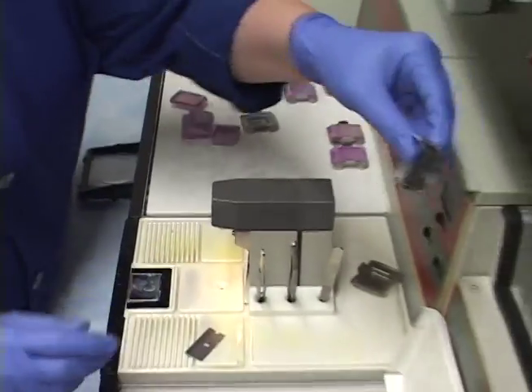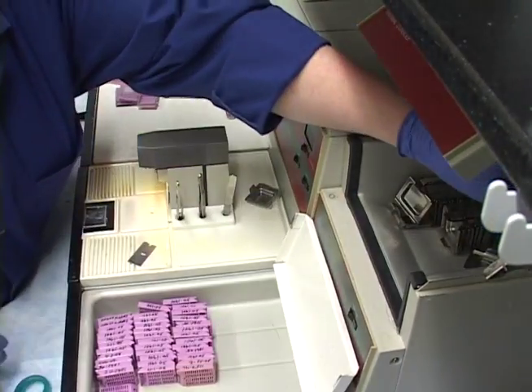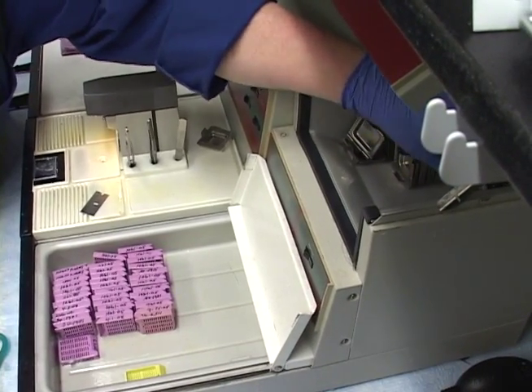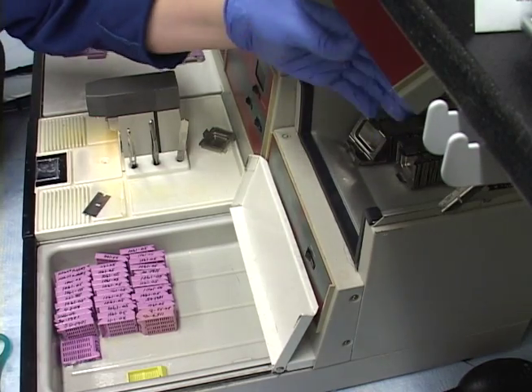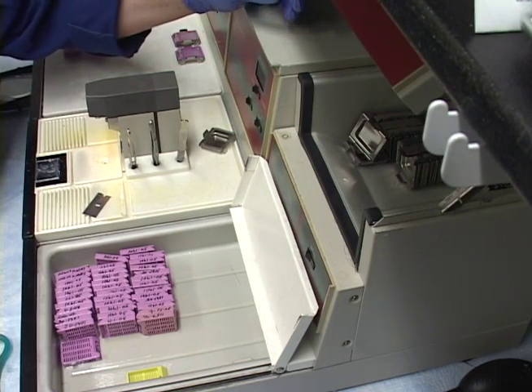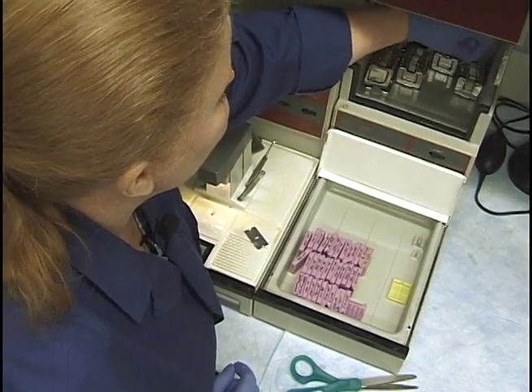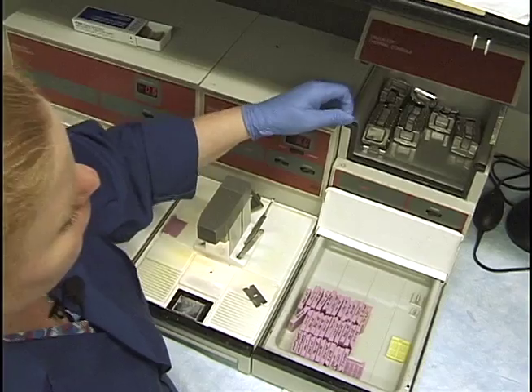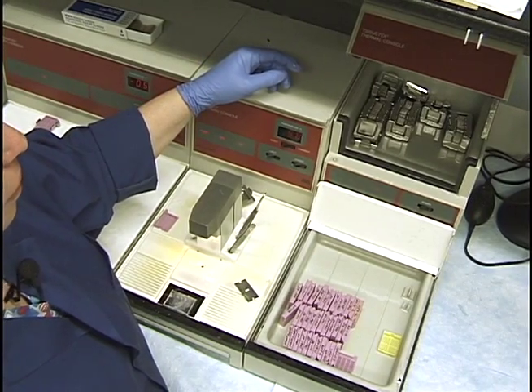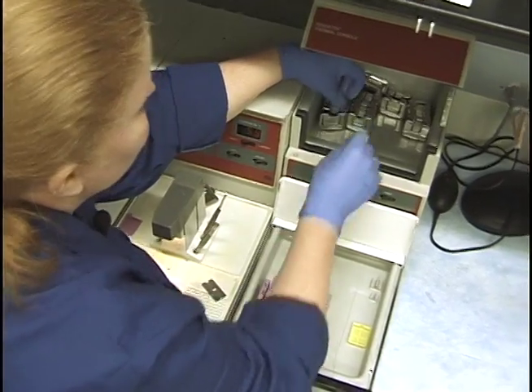The molds are fine — they go right back in. I put them towards the back so they get melted and I can still use the warm ones in front. I try to keep all the molds nice and organized: small ones together, others separate. If you do things consistently, it makes your life easier. If they're just flung in any which way, it's a hassle and keeps them dirtier.